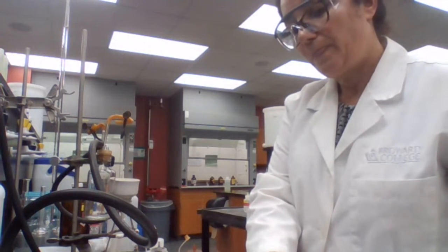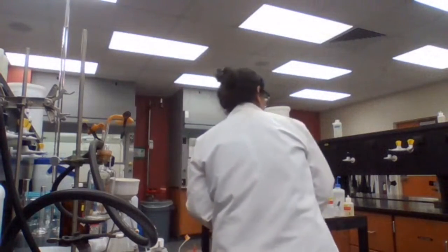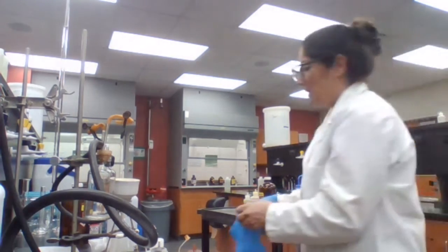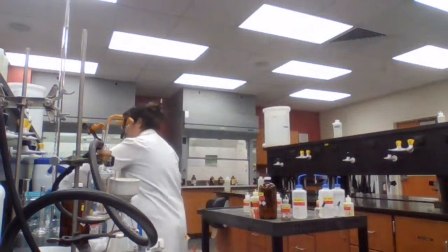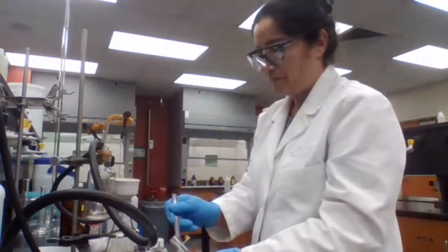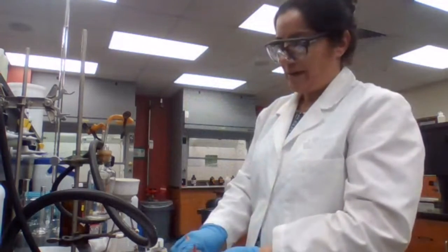Dissolve the sample in acetone and add chromic acid. Okay. This is the chromic acid test.